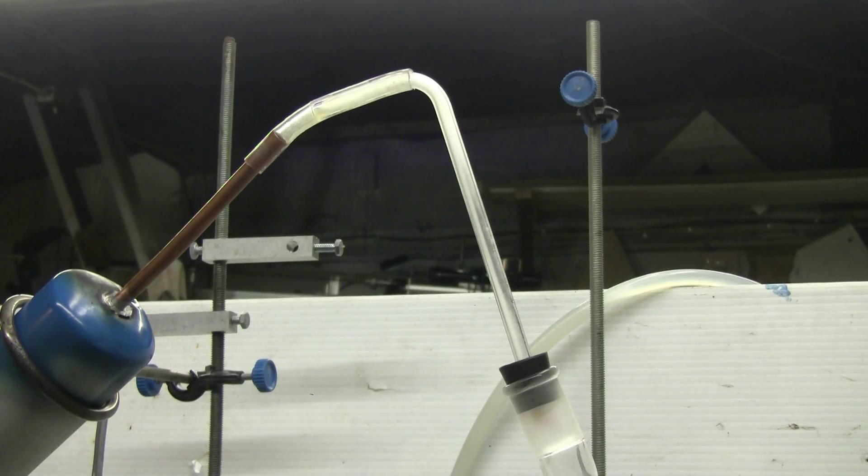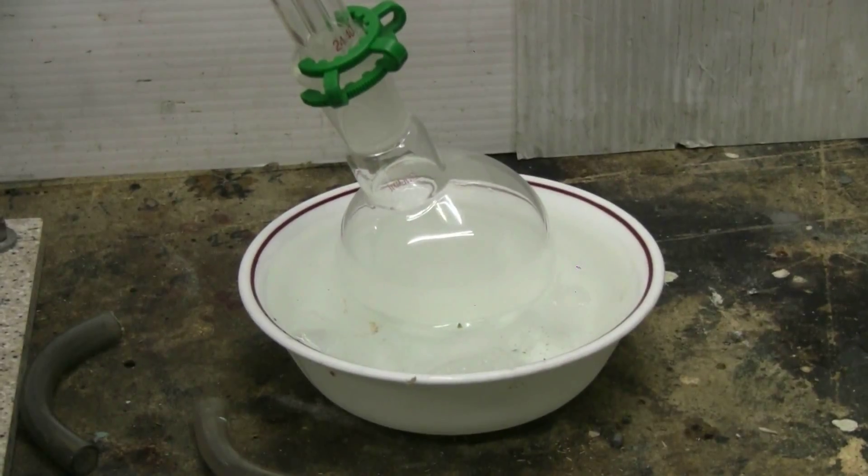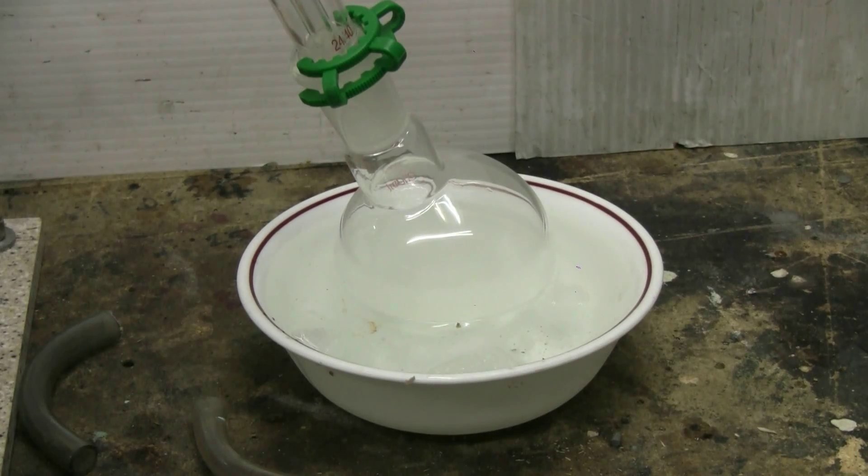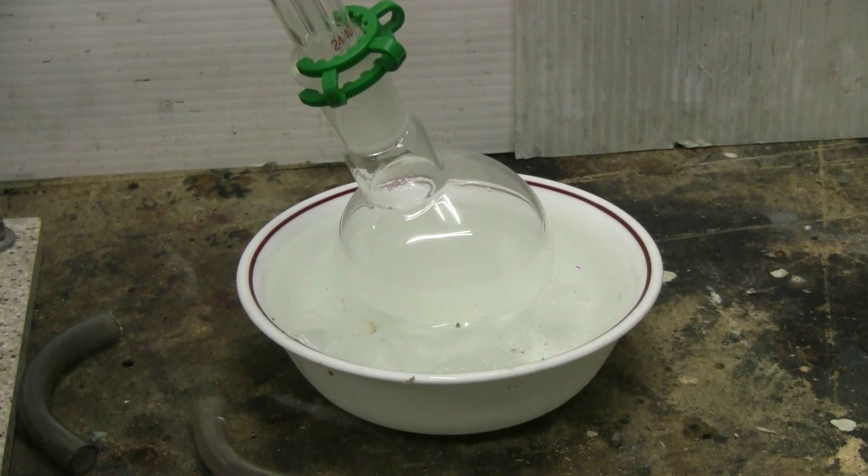It's in the form of a white fog that can be seen inside my glass tube that leads down to the condenser. Some of this fog can be seen, although not very easily, here in the collection flask.